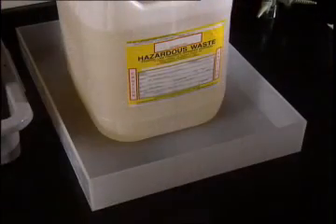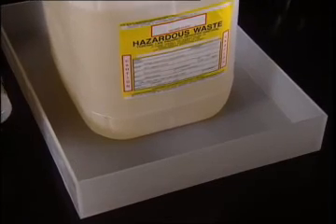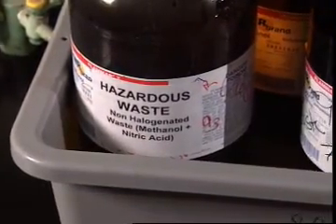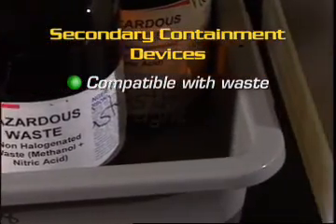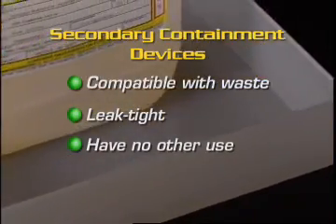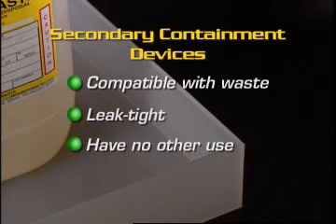It is always a good idea to place some type of secondary containment under and around satellite containers to collect any spills or leaks. A simple metal or plastic tray is often adequate for smaller containers. These containment devices must be compatible with the wastes being accumulated and must be leak-tight. These secondary containment devices should not be used for storage of any other materials, equipment, or supplies, not even temporarily.